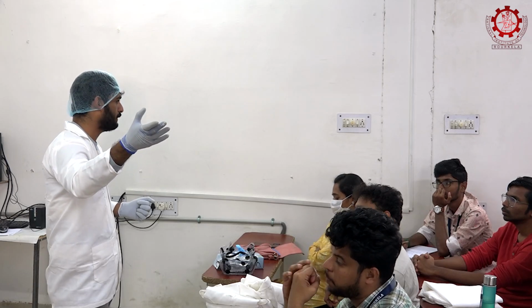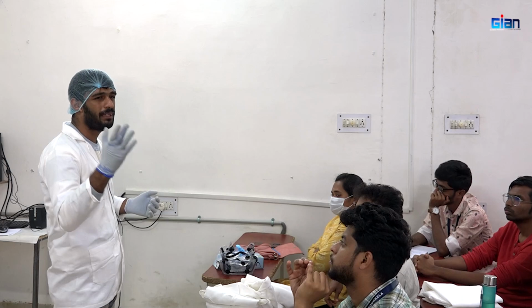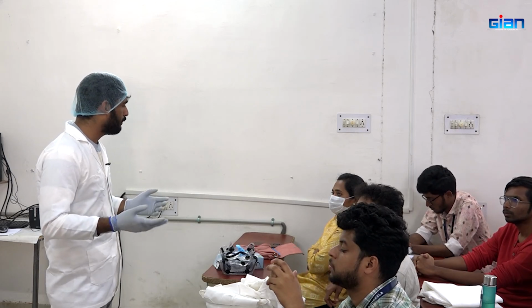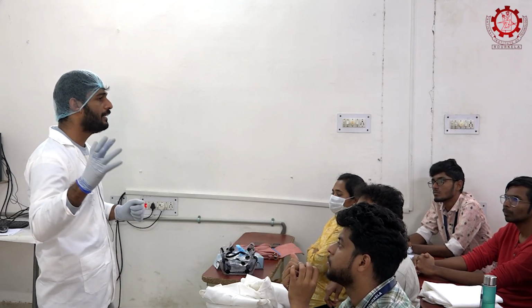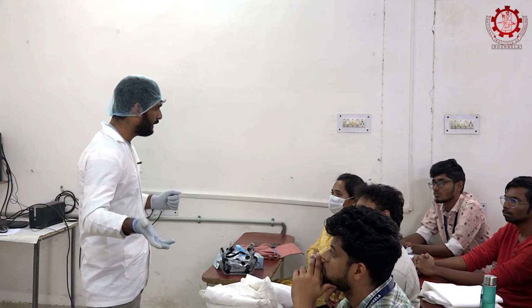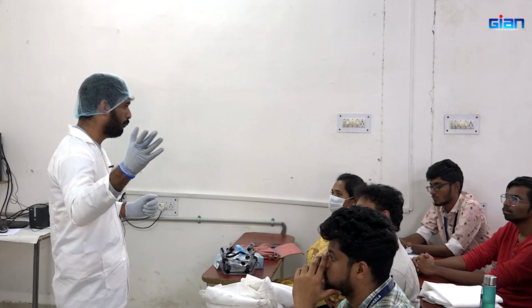We will be showing this dissolved fraction for your better understanding. It will be a different color because we didn't go for depigmentation. Astaxanthin is the major pigment present in the shells. So we did not go for depigmentation. Some of the pigment may dissolve in acid, so that's why the color is brownish in nature.